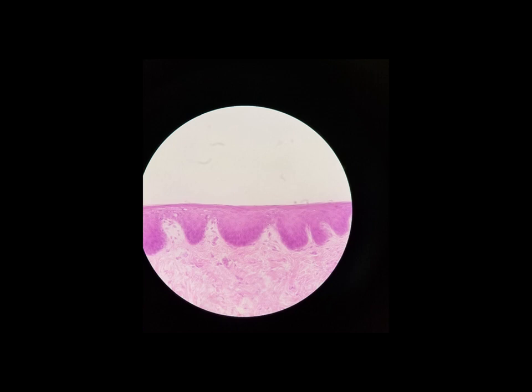Now here's our first actual stratified tissue that we're looking at, and we're looking at the dark purple in this slide. This is stratified squamous epithelium. Remember, stratified, more than one layer. Squamous, the cells are squashed or flat. And if we look along the surface here, we can see lots and lots and lots of layers of really flat cells. So this is that stratified squamous epithelium.